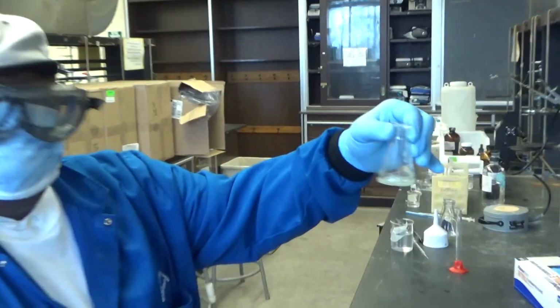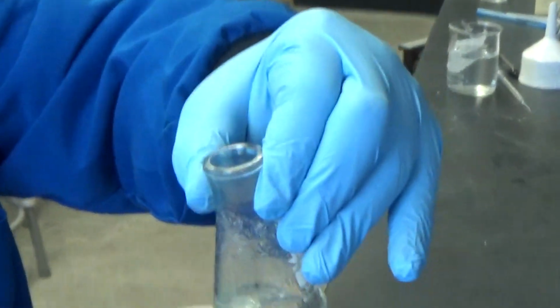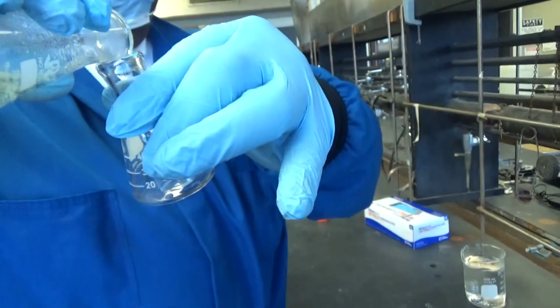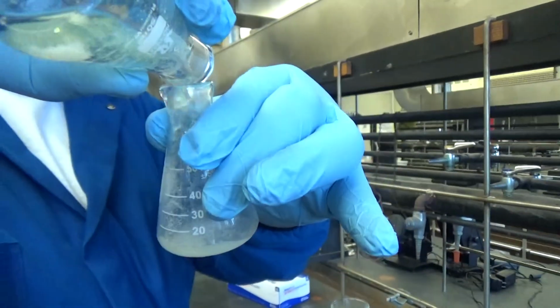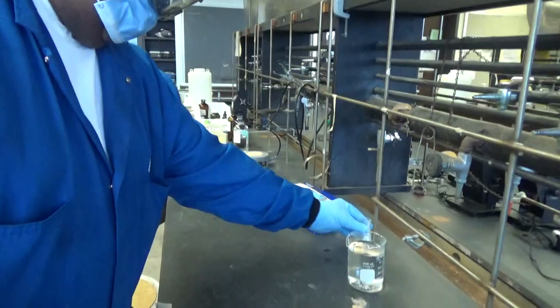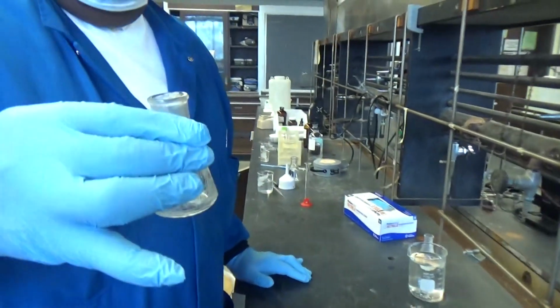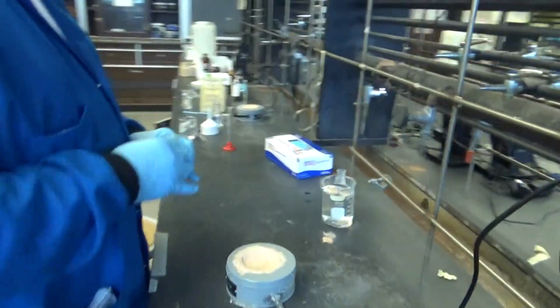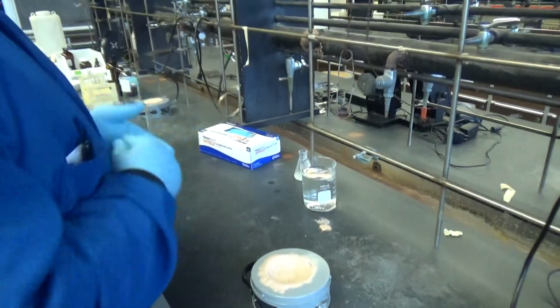As you can see, it's all dissolved, mostly. There's a little bit of stuff, but that could be bad stuff. So when you have some of that, you just do what is called a decantation. I'm going to decant. So you decanted it, which basically means you poured it while it's hot from one flask to the other. That leaves behind a little bit of junk, and the good stuff is in the second one.